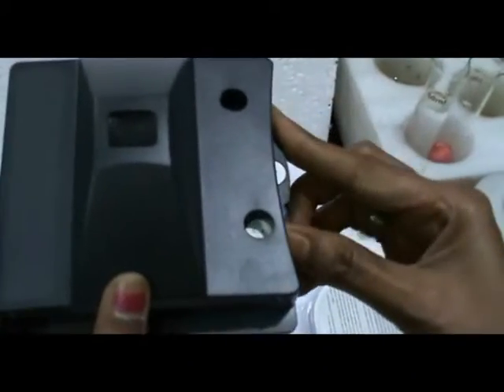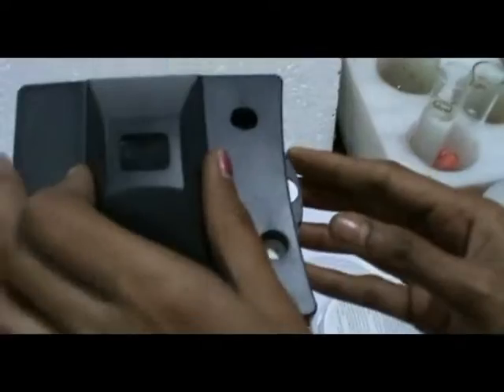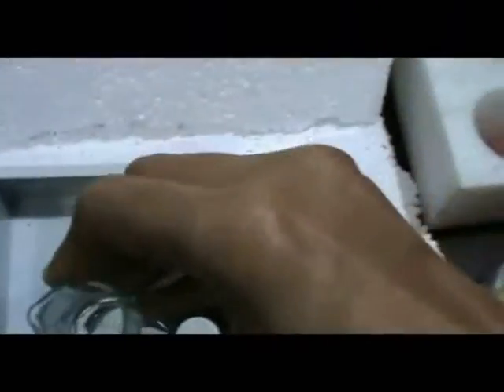Insert the disc as per your requirement — for pH, chlorine, or whatever parameter you need. Keep the blank solution in one Nessler cylinder and keep the sample in another cylinder, prepared with the use of a reagent or DPD tablets.